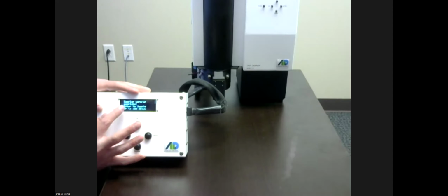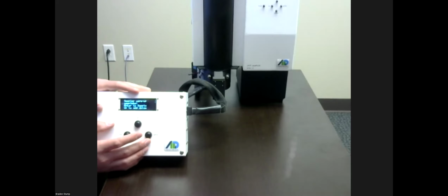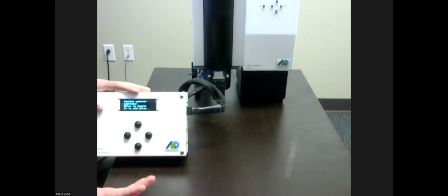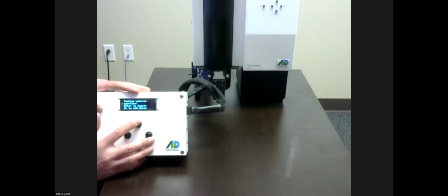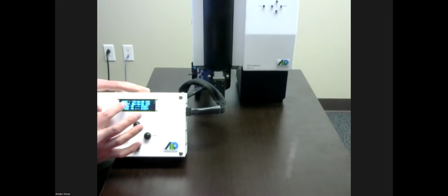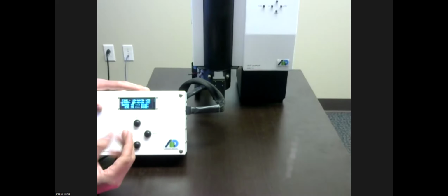Great. So now this says sampler warmup complete, enter to sample or up to add delay. If I hit enter right now, that sample will immediately start. However, if you're looking to do some sort of delayed sample where you're arming it to start at a certain time, you can press up here and you can select a UTC time. So the top row is the time that it currently is with the real-time clock. And then the start time is sometime past that in the next 24 hours.